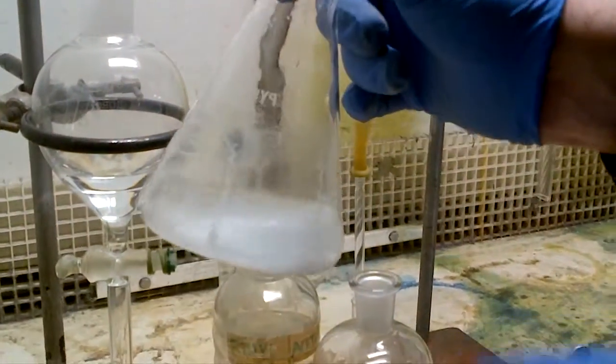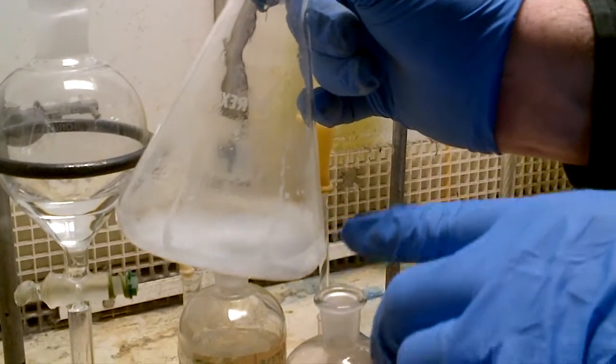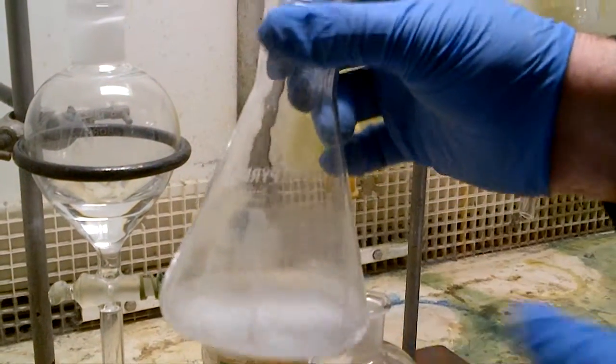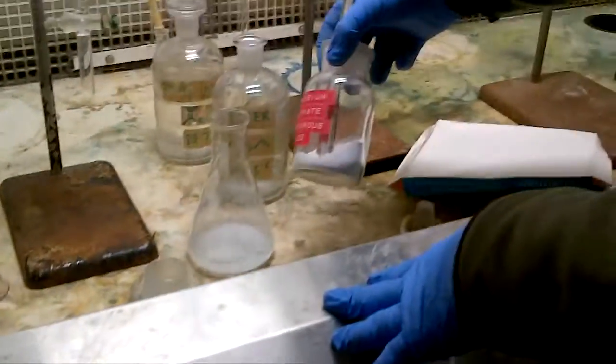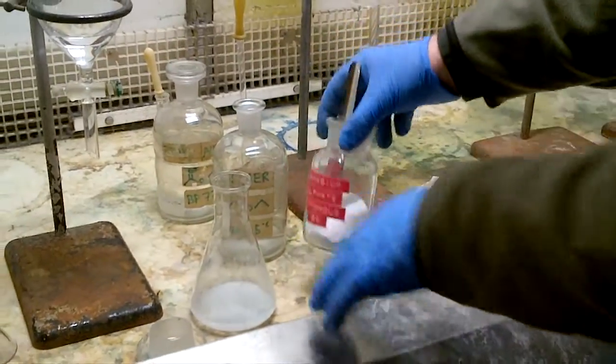And when we swirl it, we want to see these little clots of mag sulfate in solution, that's settled down, and that is dry, that's good, that's a good quantity of mag sulfate, what you don't want to do, is to throw the entire bottle of mag sulfate into there to dry a small volume, so this shows you today, how to use the separating funnels as well.